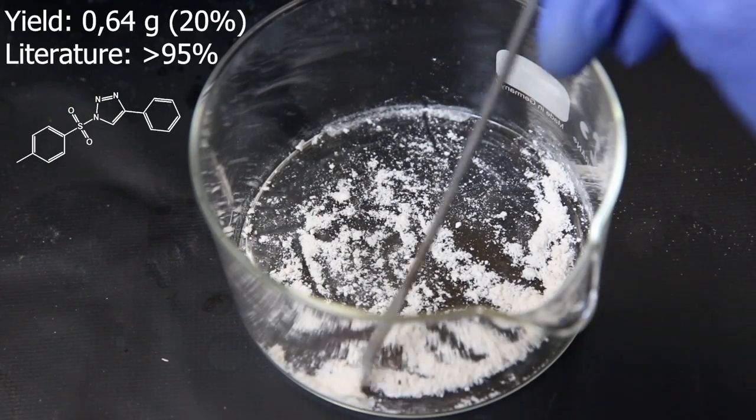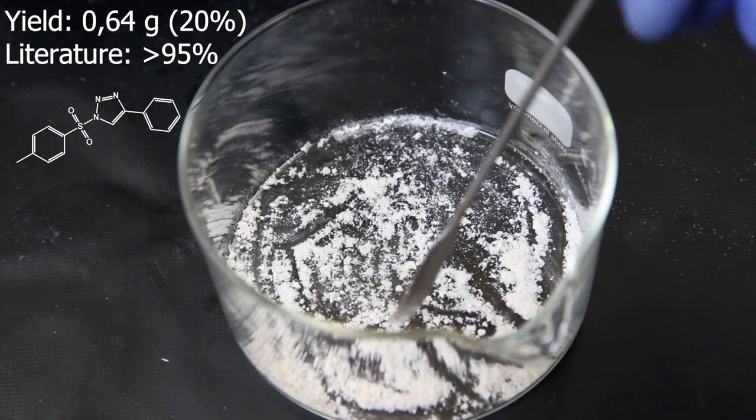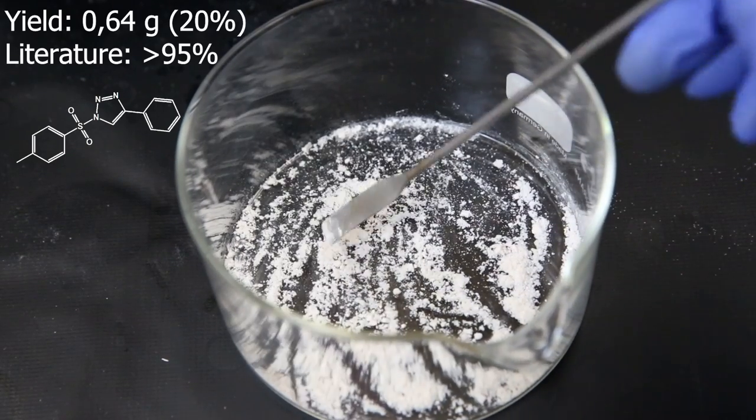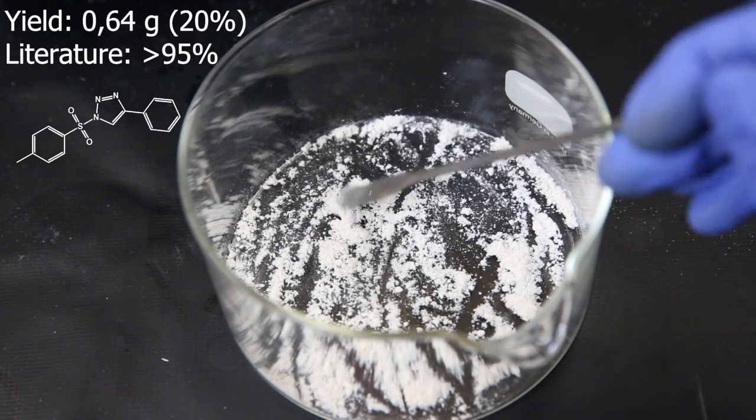We did see total consumption of the azide on the TLC, which tells us that at least everything had reacted. The reaction is of course still very simple and should work very well. It is just this specific product that is very annoying to column.